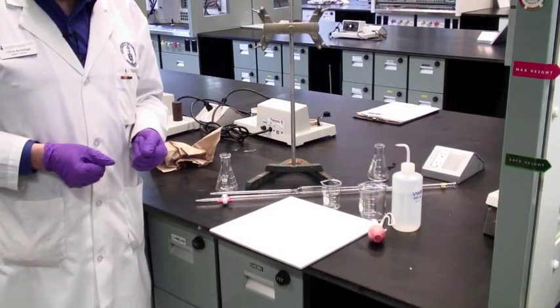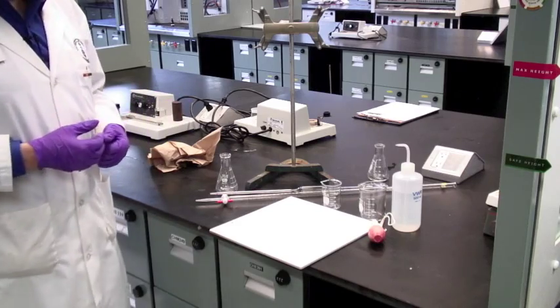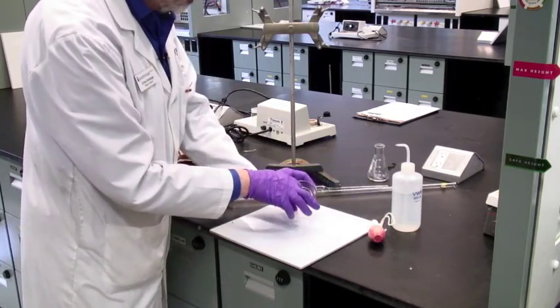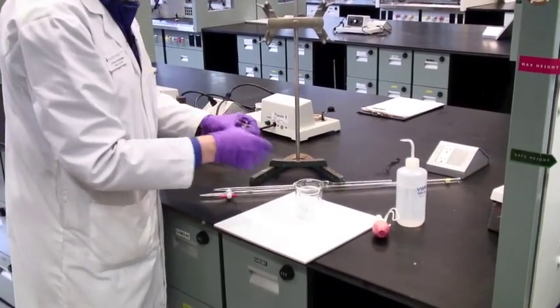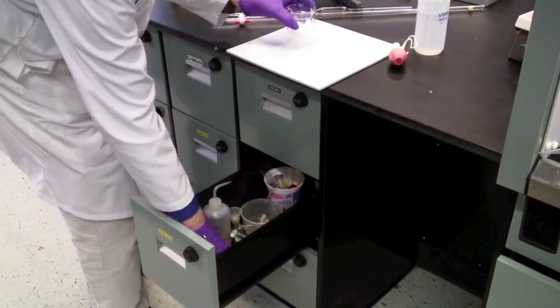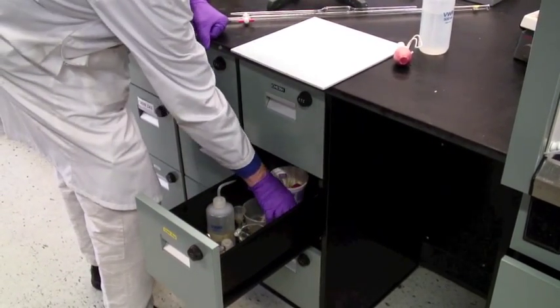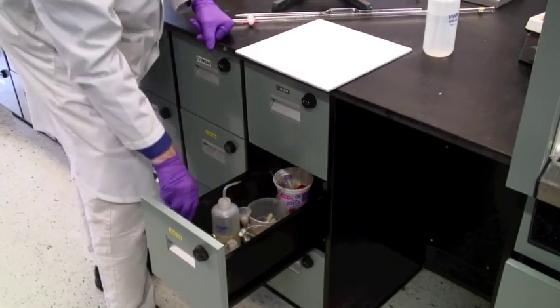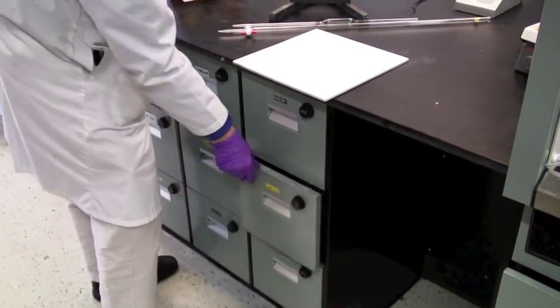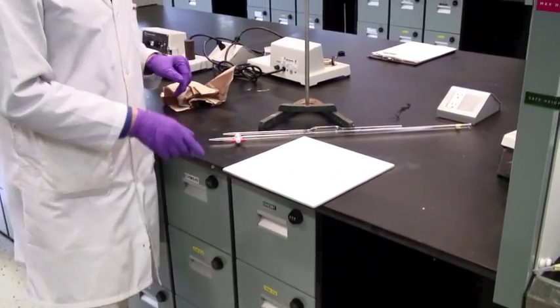Now, your bench may well look like this when you're finished and ready to go for the day. The things that are clean, the glassware that is yours, the flasks and the beakers, for instance, just go straight back into your locker along with bulbs and your wash bottle. Close this off. The rest of this stuff that I've left here is not.